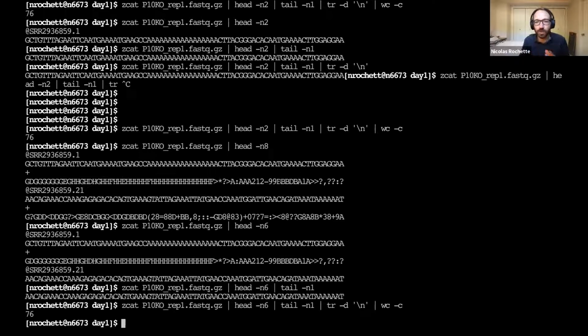So in this case, FastQC. Has anyone finished running FastQC? The QC in FastQC is kind of a play on words. It's FastQ and at the same time QC, which is quality control. And so the first thing is to run FastQC, and the second thing is to download the HTML report, and that's going to show you a bunch of graphics.